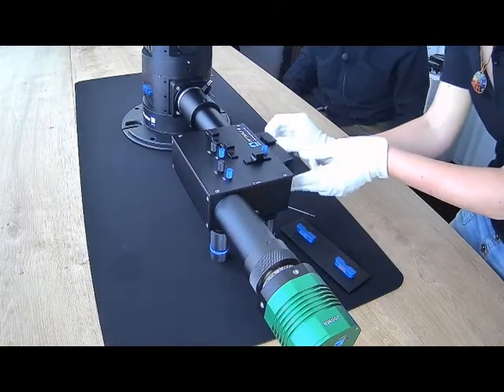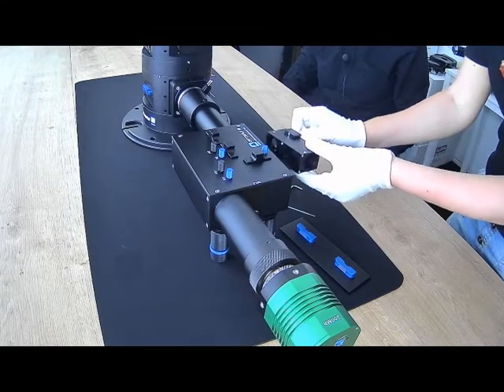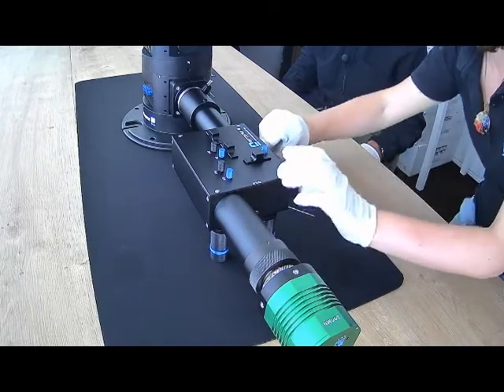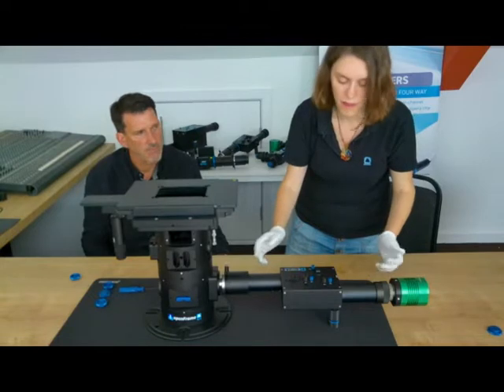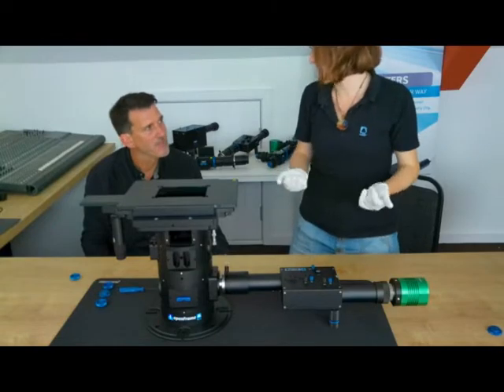It's got our 3-way splitter cube, which uses our Chroma Ultra Flat Dichroics and standard 25mm filters. It's just got a dovetail mechanism to hold it in place. And the same with the other ones, we can use it to support F-mount cameras on request.